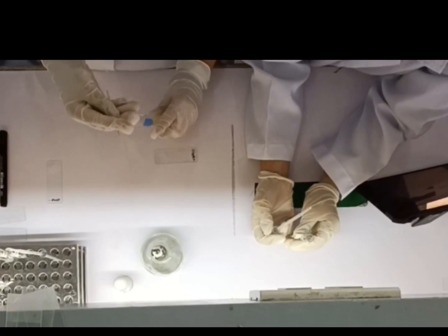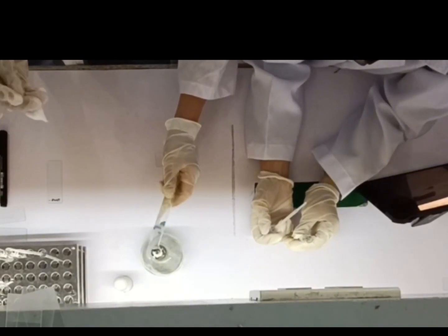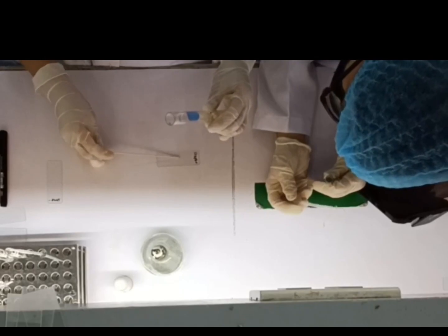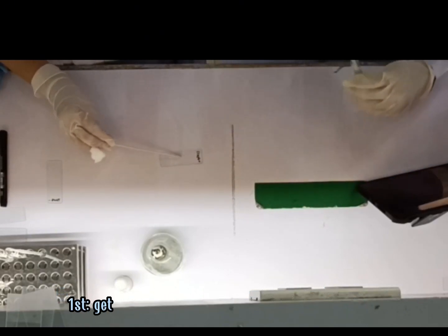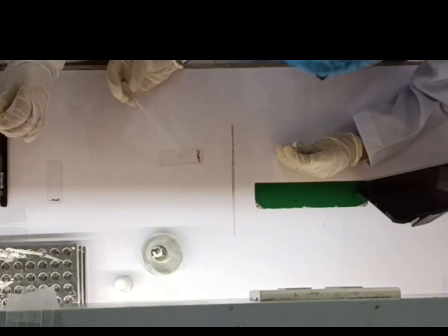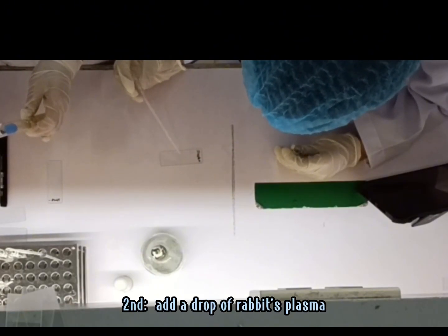There are two tests under the coagulase test, the slide and the tube method. To perform the slide coagulase test, we need to get a few colonies from the tube using our sterile inoculating loop, and then emulsify the colonies on a clean glass slide. After emulsifying, add a drop of rabbit's or human plasma and gently rub the slide.